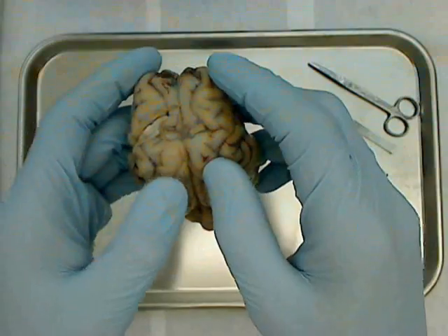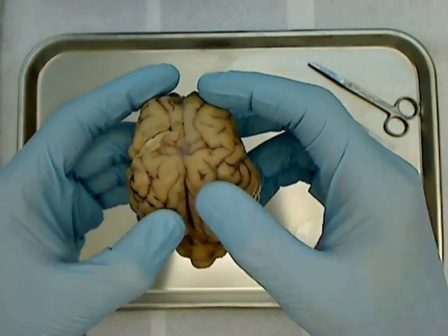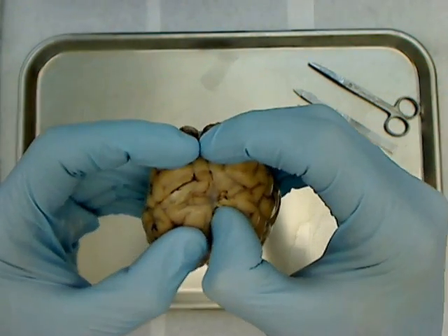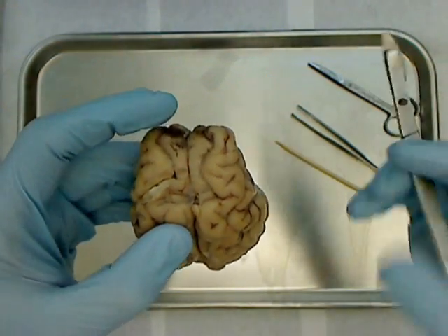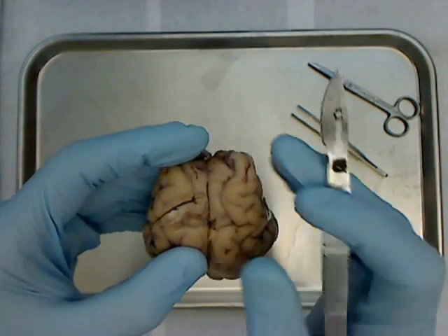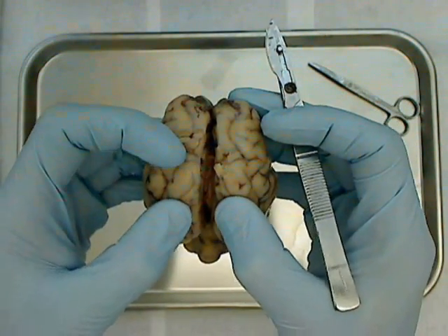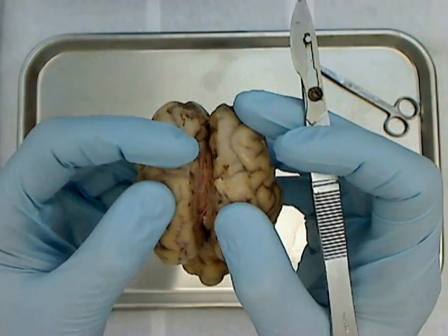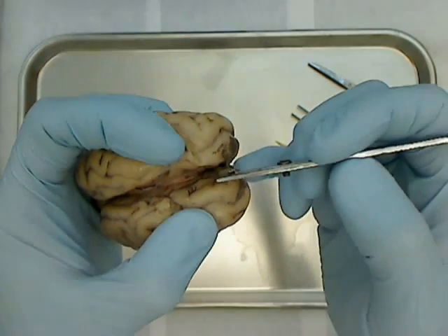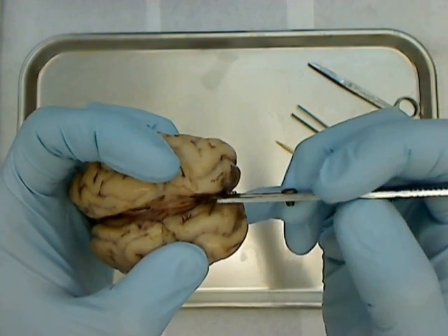To begin a bit of the dissection, I'm going to start separating the right and left hemispheres of the brain carefully. The pia mater is connecting the two sides right now. I'm going to try and do it very gently. My right hemisphere is coming apart, so I'm going to use my scalpel to separate these tissues a bit. I broke part of the corpus callosum — that's what I was trying to get down to so that you could see it. If you can see down in here, there's a little bit of white tissue that's connecting the left and right hemispheres of the brain. That's called the corpus callosum.